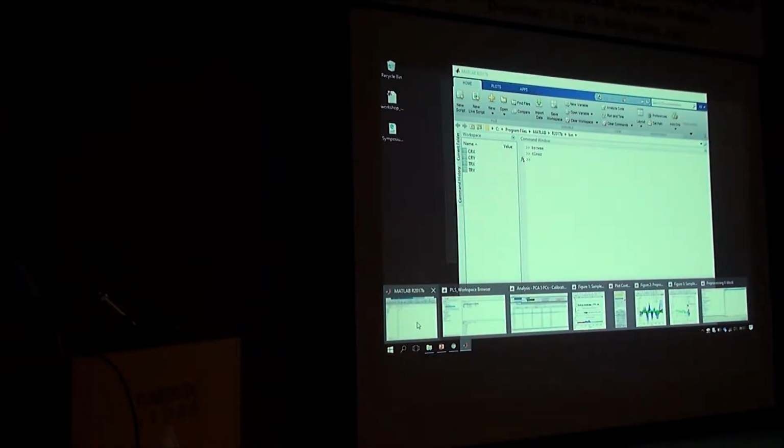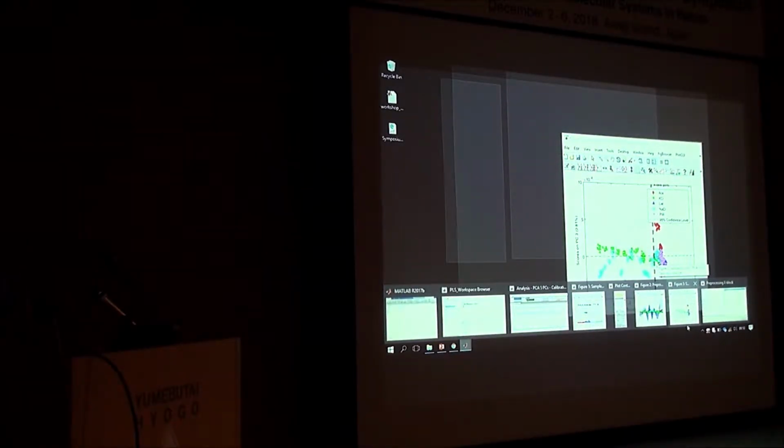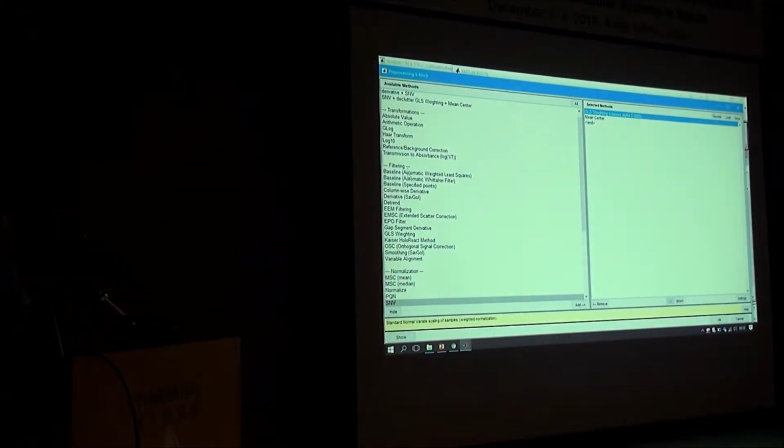Because for the competition data, I had to try all sorts of different optimizations to make sure that you get the best result. This is a GUI. What you're seeing is a graphical user interface, where you can close everything and just run the codes, and you get the displays you want. And tomorrow we'll have a feel for that. But I just want to quickly show you what you can do and how important this can be for your work in aquaphotomics.